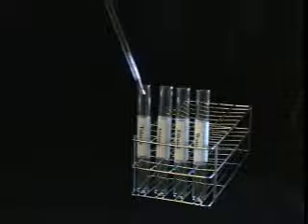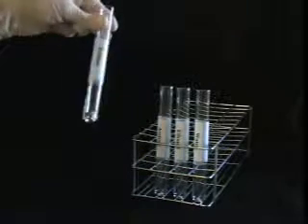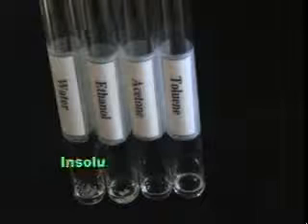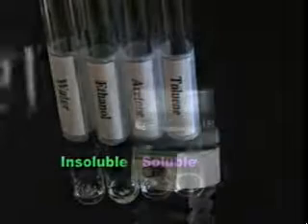To perform a solubility test, place approximately 20 milligrams of your compound in a test tube. Add a half of a milliliter of the appropriate solvent and swirl. Wait a couple of minutes and then make note of whether or not the compound dissolves. For example, at room temperature, naphthalene is insoluble in ethanol and water, but soluble in toluene and acetone.